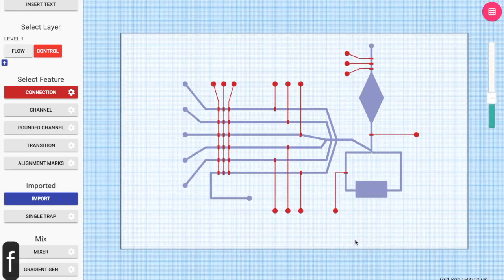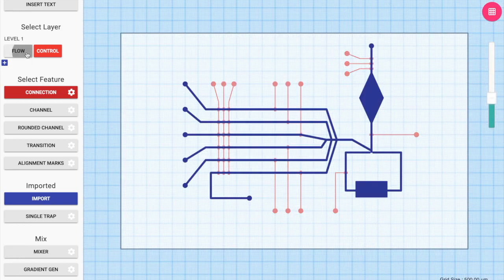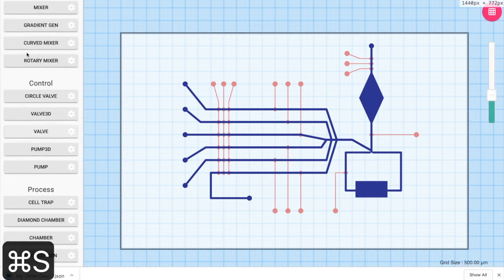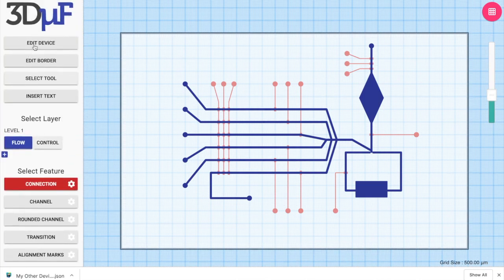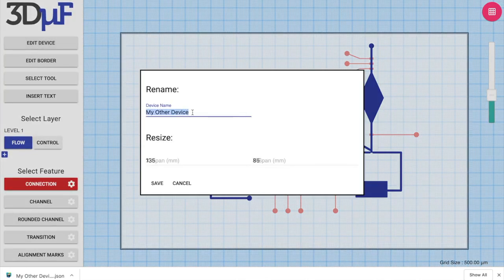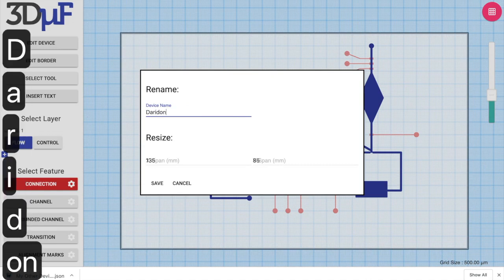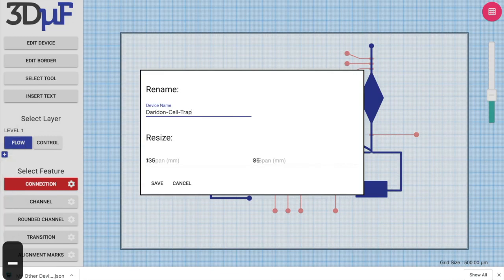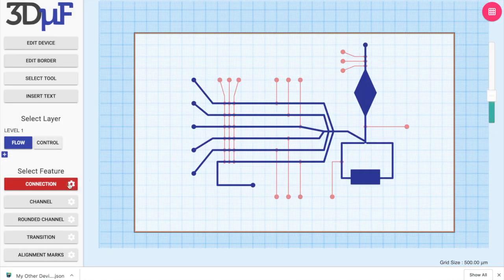And that concludes the design of the Daridon cell trap. Now we can anytime save the device design by clicking Ctrl S, and because we wanted to save it as Daridon celltrap.json, we rename the device by clicking on the Edit Device button, and now the new JSON file has Daridon celltrap as the name of the JSON.